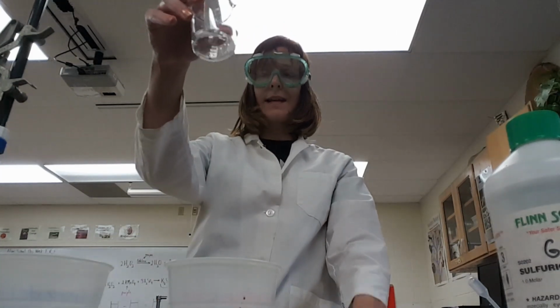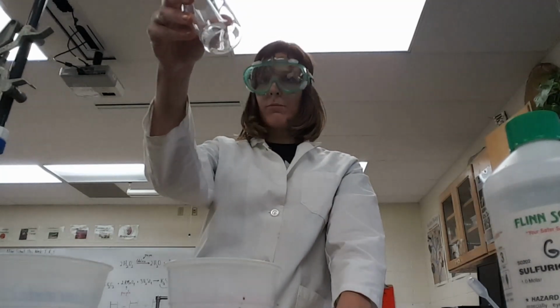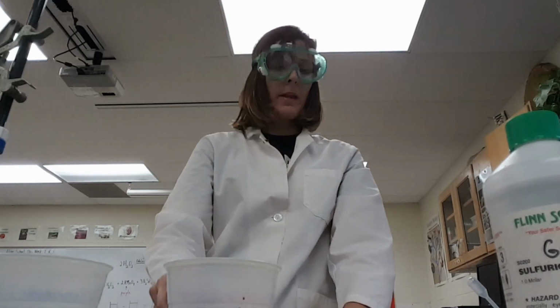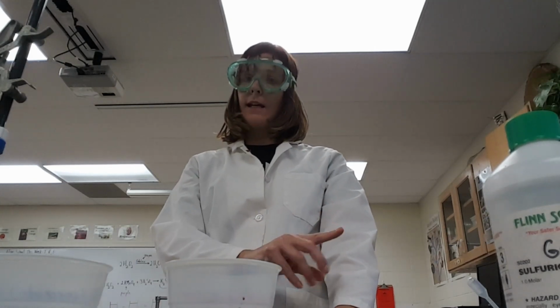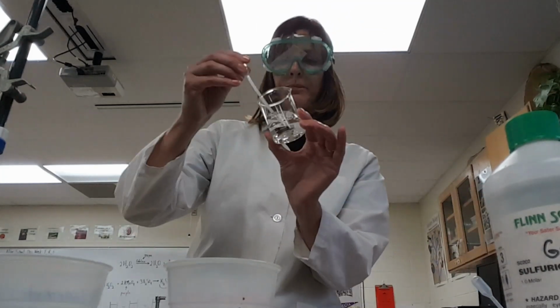I don't want to digest any of this. I just want to know how many hydrogen peroxide molecules there are in this, because it's not pure hydrogen peroxide, there's also water molecules. And so we have to know how many hydrogen peroxide molecules there are in this concentration. All right, so because we need to keep everything the same as when we end up having our catalase present, we would be adding 1 milliliter of catalase to our treated ones, but this one being non-treated, we have to add 1 milliliter of water.